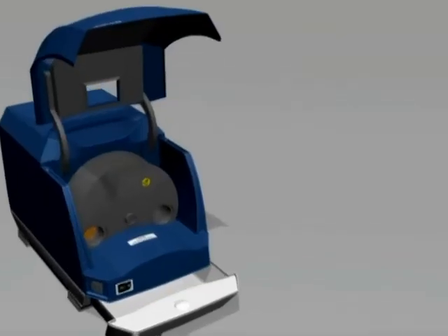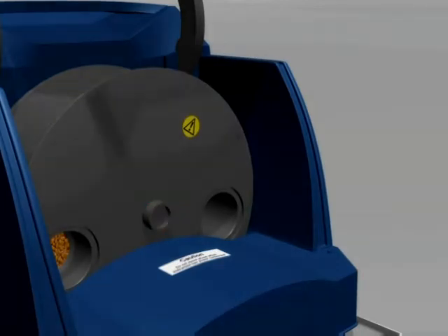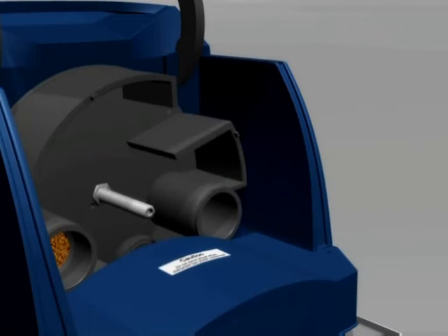To start cleaning operations, the front cover of the sample wheel should be removed. The cover is attached to a tightened nut, so it is removed when the nut is loosened for the cover to be lifted away.